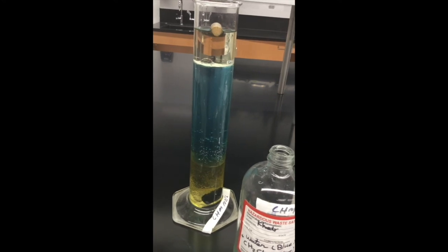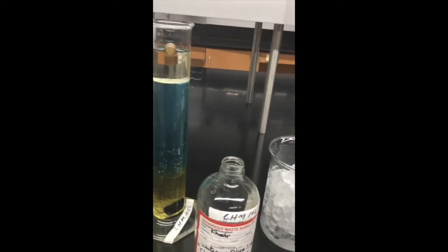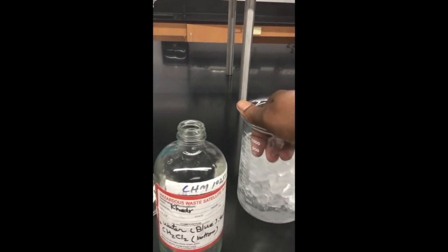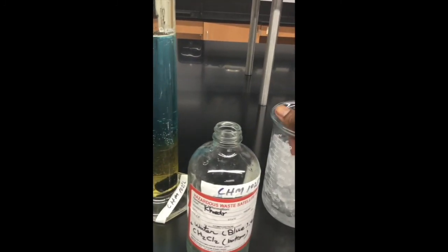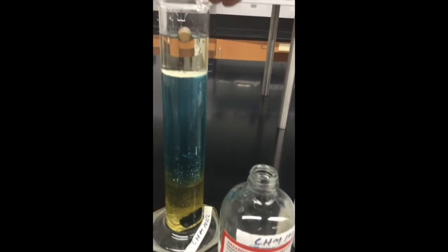Where will it be? Lastly, what I'll add in there is the ice. I have ice here. You just have to indicate where it's going to be. Hopefully it's going to be visible from where you are. Right now, this is the ice cube.